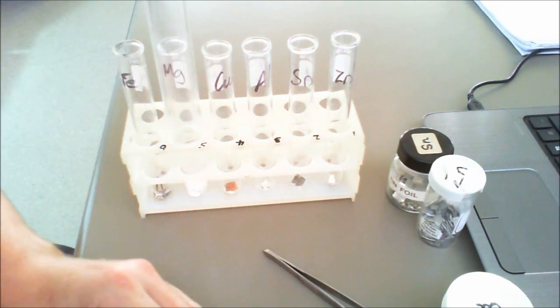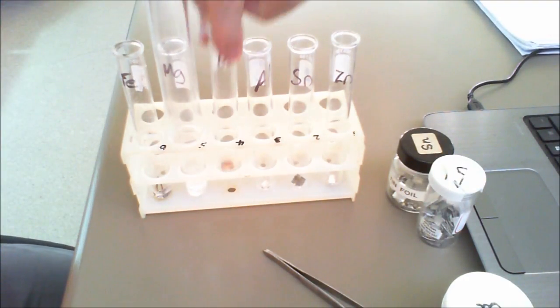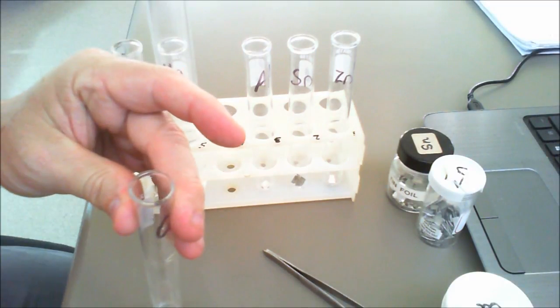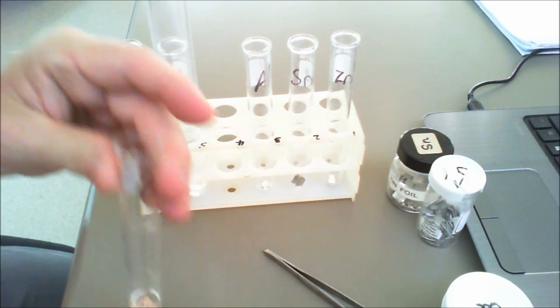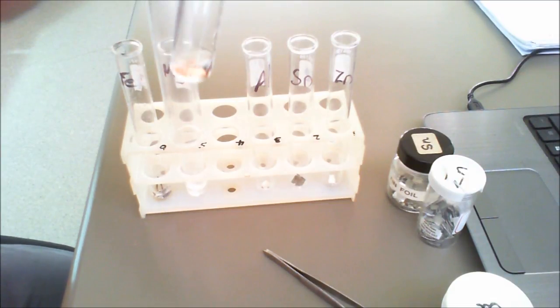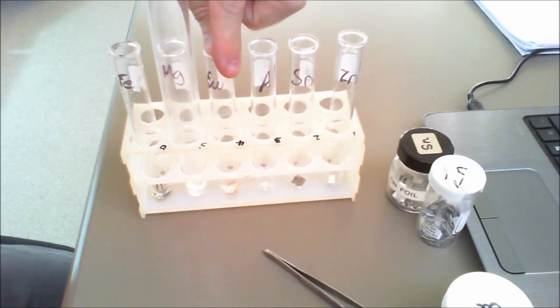Our next one will be copper. We do two squirts over the top of the copper, and you can see there that there's nothing happening at all. It's just basically like water onto it.